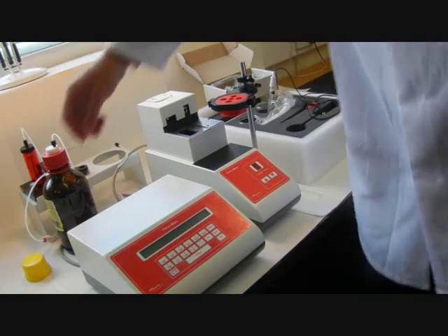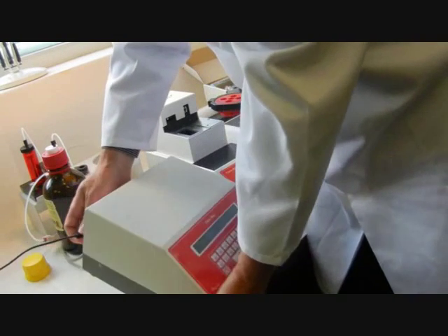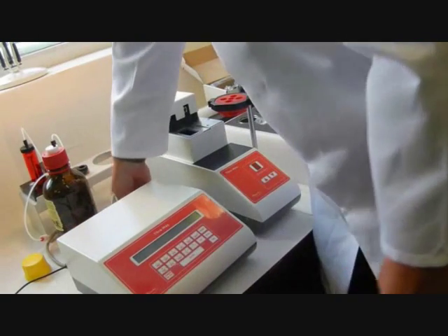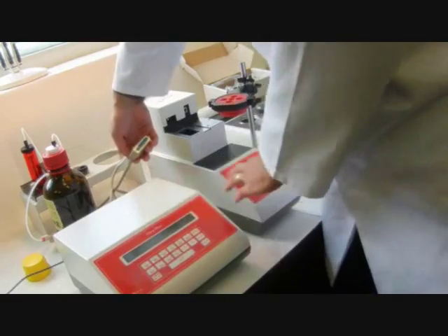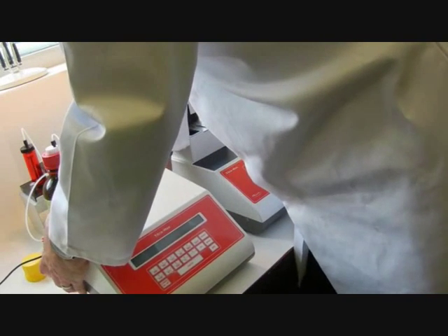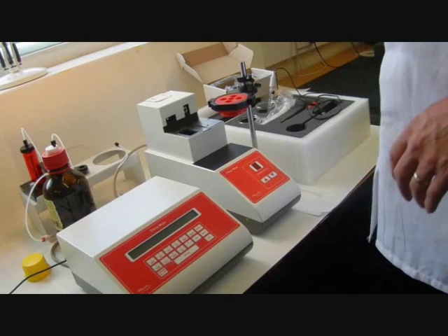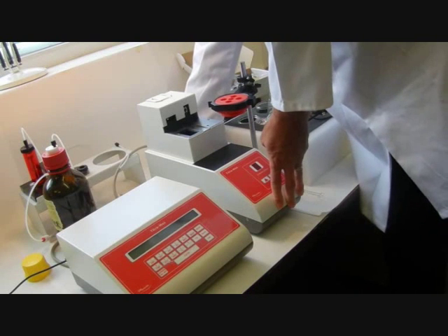The first thing to do is connect the power cable to the back of the control unit. Next we can connect the titrator D connector to the base of the control unit and also the other end of that lead will go into the titrator base.